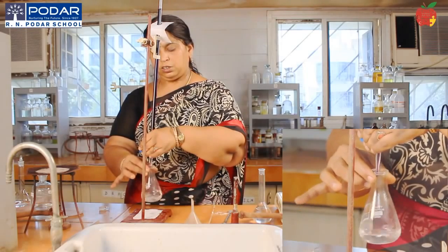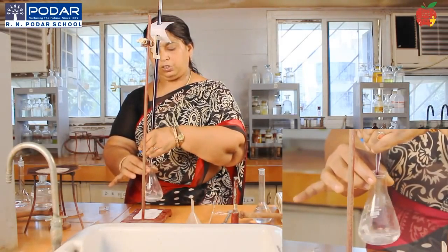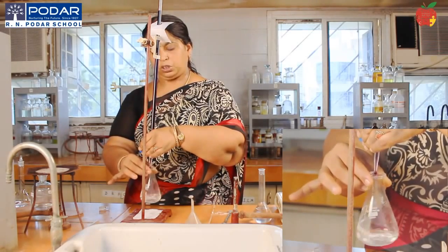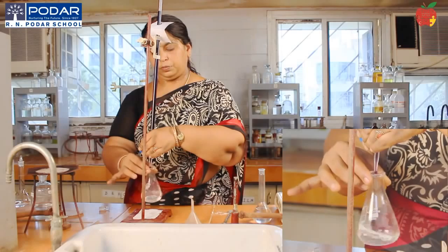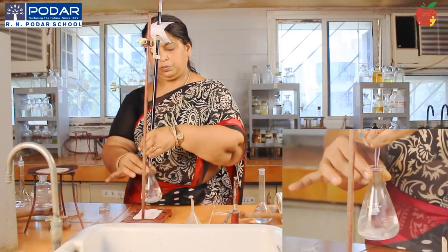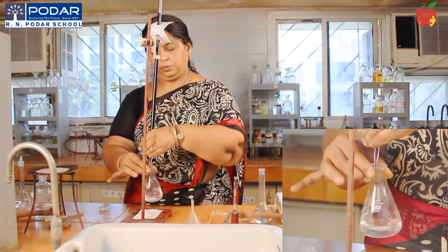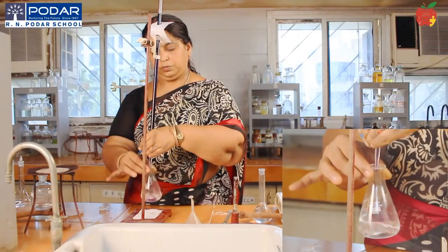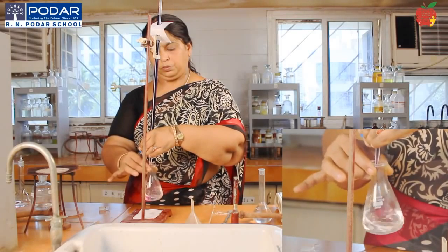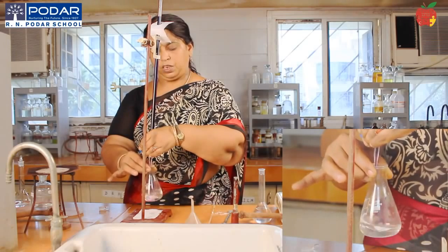Even if it happens, try to take the drop into that so that the KMnO4 is being used up. Add it drop by drop.